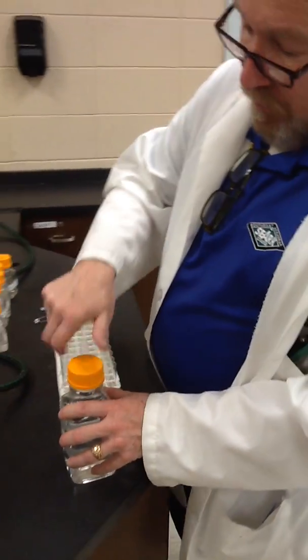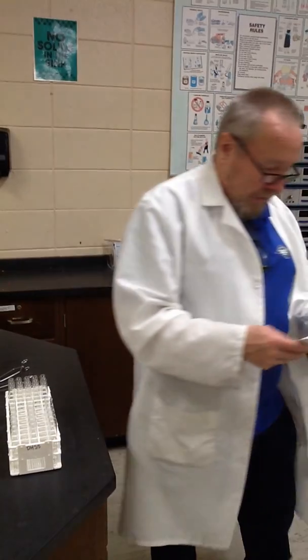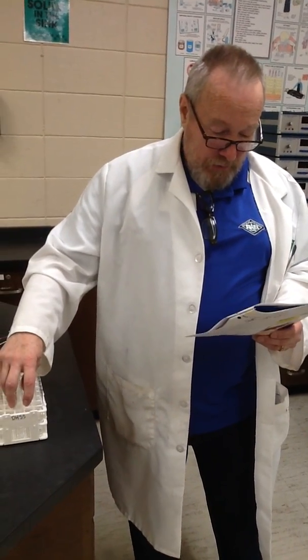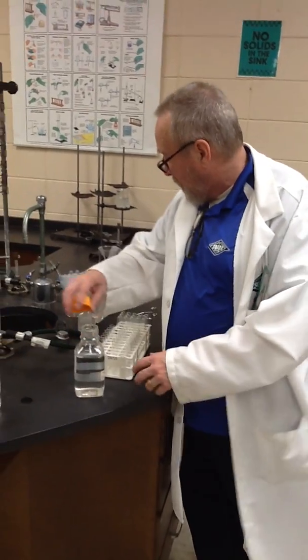And then, if you read your instructions, it says, refill each test tube with 10 drops of appropriate metal ion solution listed in Part A, Step 2, which I've done. That's why I made 3 rows. This is my refilled test tubes. And add 5 drops of ammonium hydrogen phosphate. And this is a solution of that, so I'm going to add 5 drops of this to each tube.